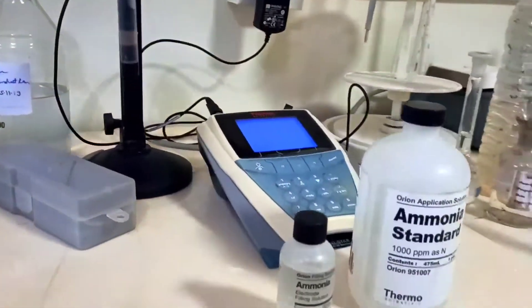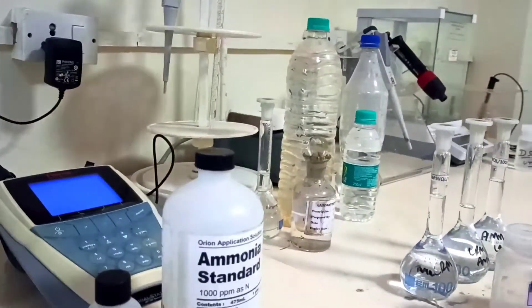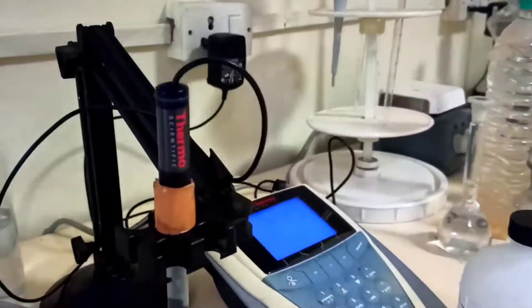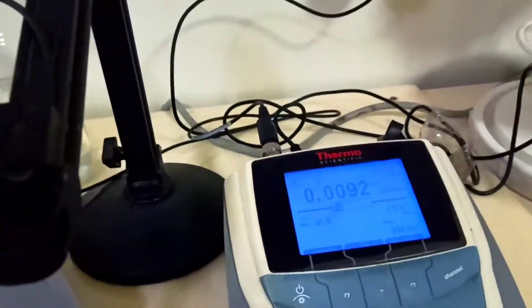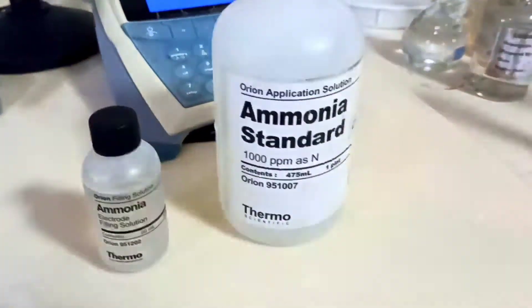Hello friends, welcome to another video. Today we are going to analyze ammonia in water, which is very useful for petroleum industries, paint industries, and water industries to estimate ammonia. It dissolves in a liquid state.